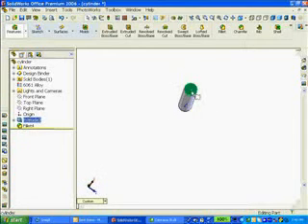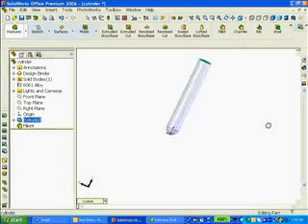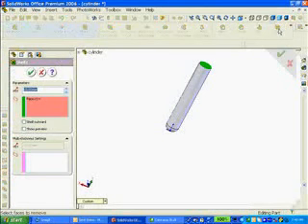Unfortunately, with this test tube, I can't put anything in it because it's solid. So I need to hollow out all the material on the inside. That feature is called the shell feature. I'll click on the top face and click on Shell. Now, what wall thickness do you use?